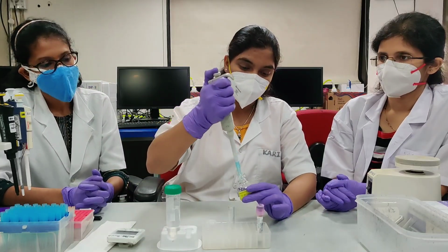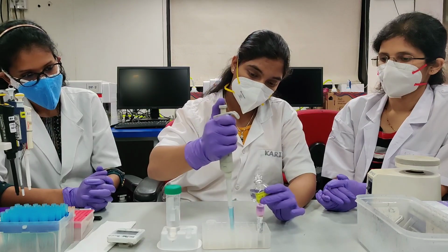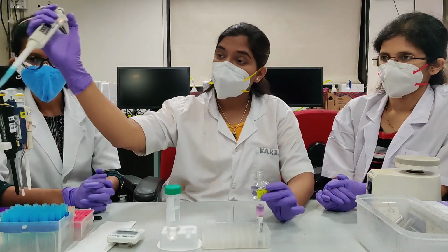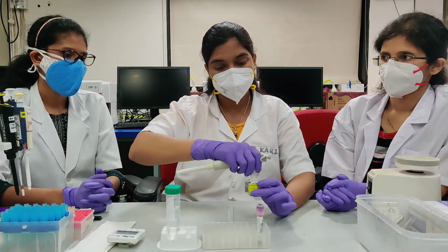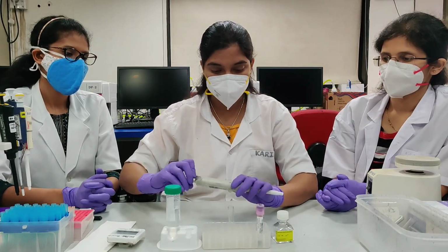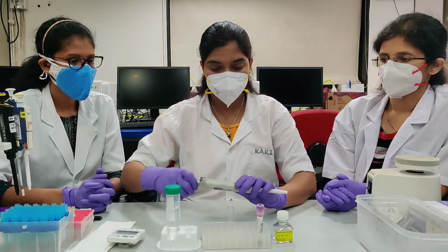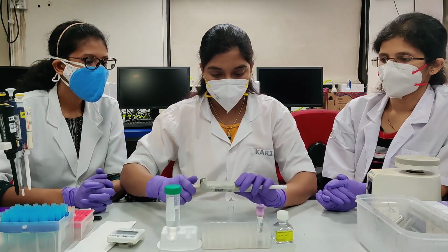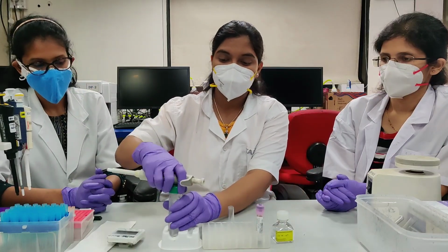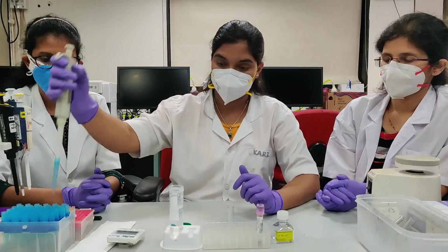I will take 500 microliter of 10x lysing solution and dilute it with 4.5 ml of distilled water to get 1x concentration.